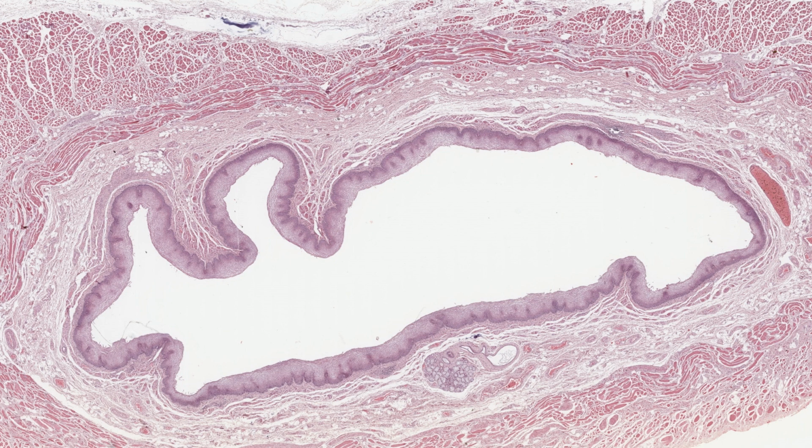Frequently, you can locate an epithelium simply by using the lowest or medium magnification of the microscope, because epithelium lines tubes and surfaces. Look for a lumen or a clear space indicating where a surface would be. For instance, here is a tube lined by cells. This tube has been cut transversely, so it appears in an almost circular profile.